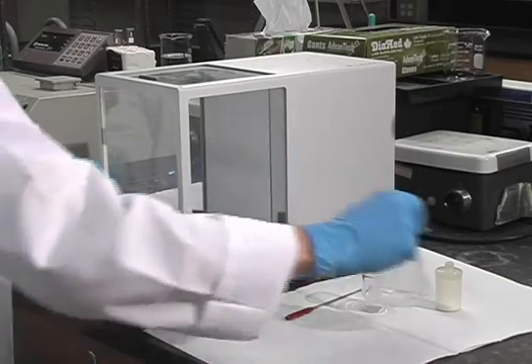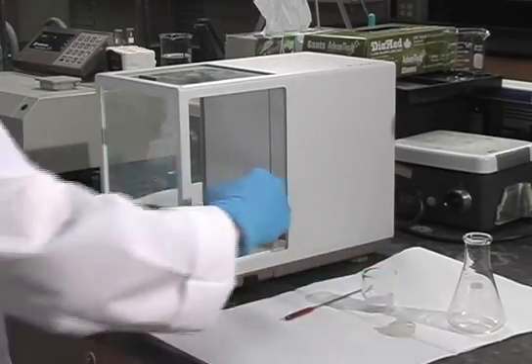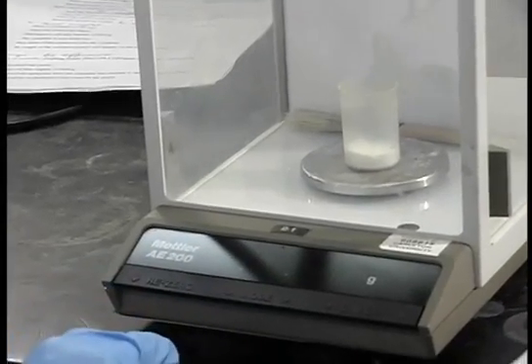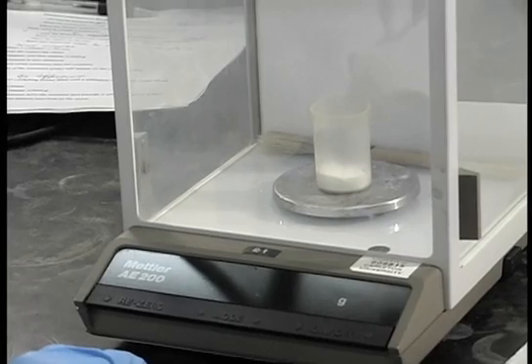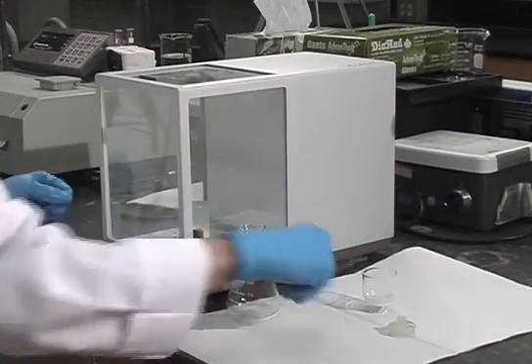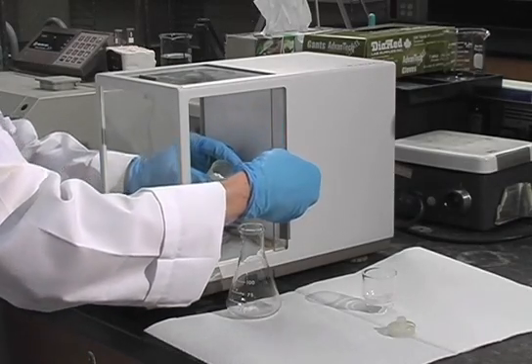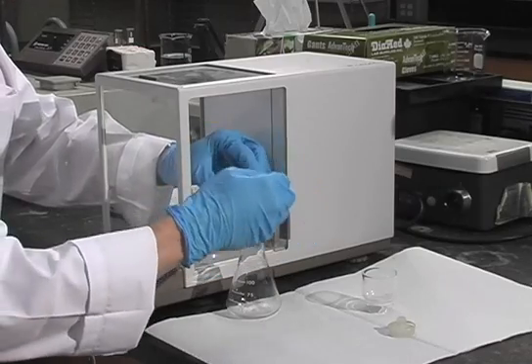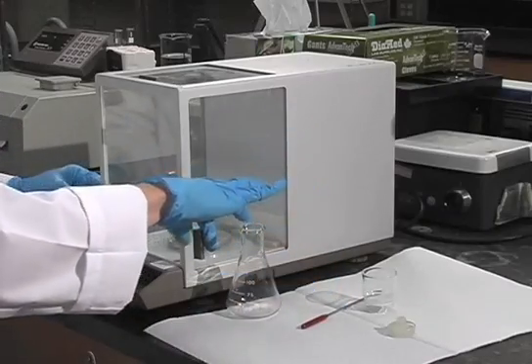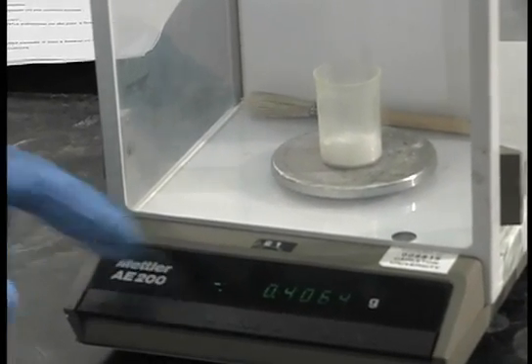The third method is weighing by difference. In this case, you put your weighing bottle on the scale and tare it out by pressing the control bar. Then remove the amount that you want from the weighing bottle. The reading you get is a negative reading, and that is the exact amount that you removed from the flask.